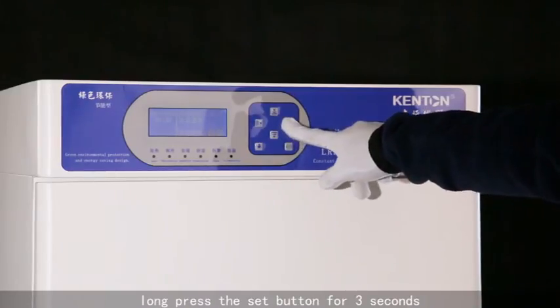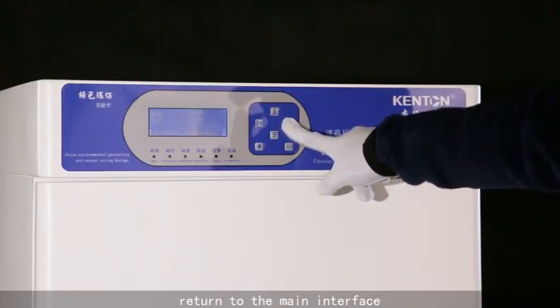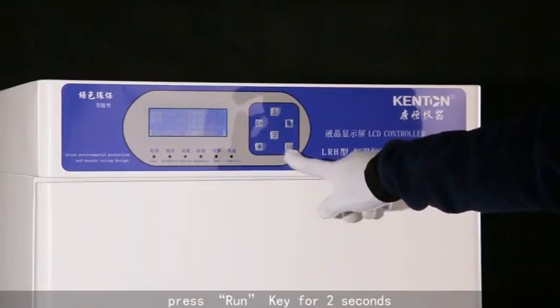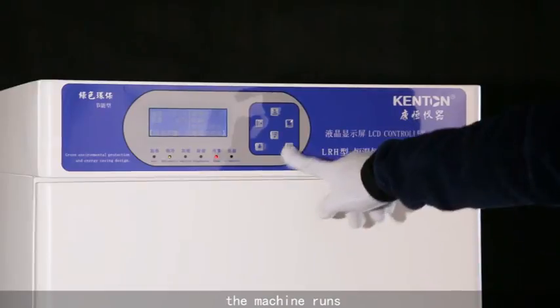Long press the set button for 3 seconds. Return to the main interface. Press run key for 2 seconds. The machine runs.